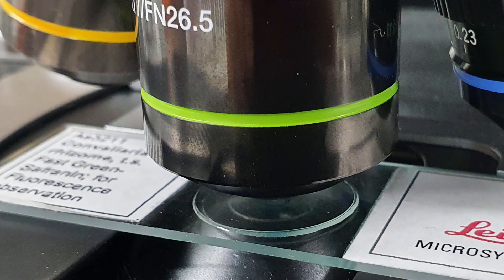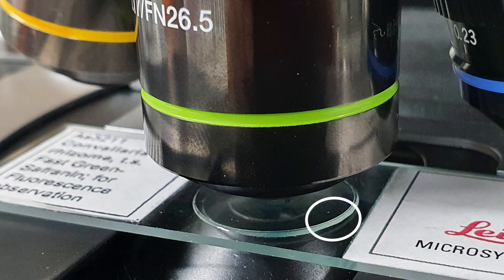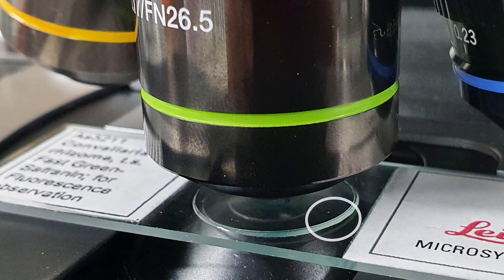If you are having trouble focusing, move to the edge of the cover slip and focus on that, as this will bring you in range to be able to focus on your sample or cells.